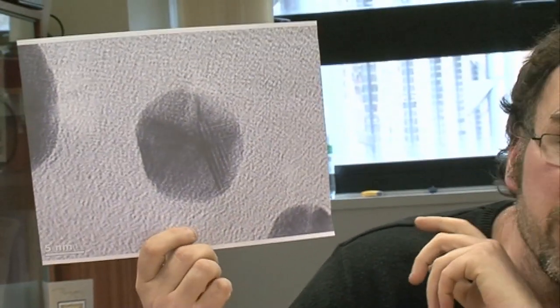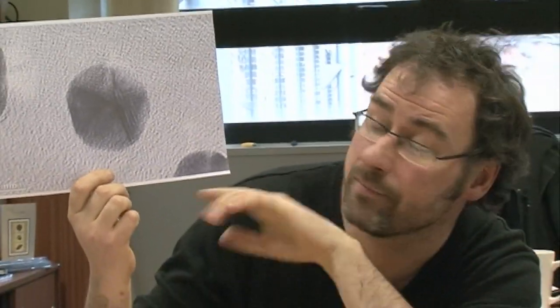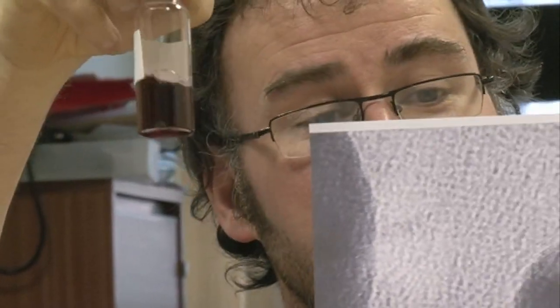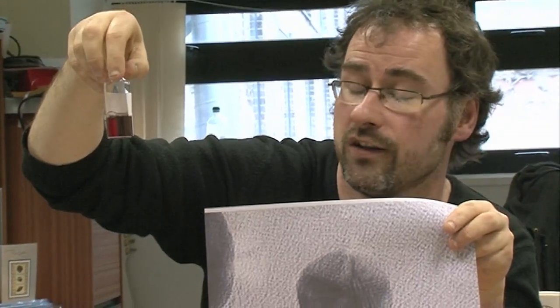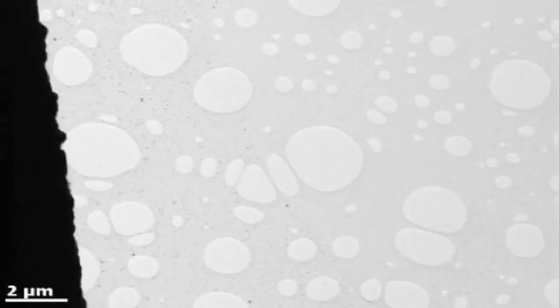This is a transmission electron microscope image, formed by having beams of electrons transmitted through a sample to build up an image. What it actually shows is a single nanoparticle from a solution of nanoparticles. A couple of days ago we had a masterclass for high school students, and the students made these nanoparticles — both they and I got very excited when we could see the nanoparticles they made with quite simple chemistry.